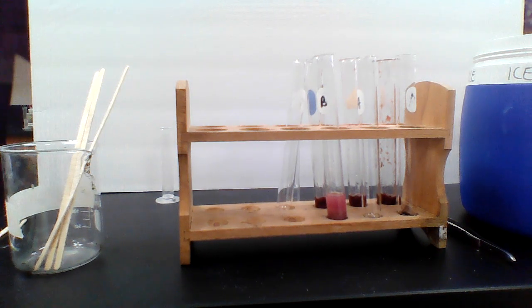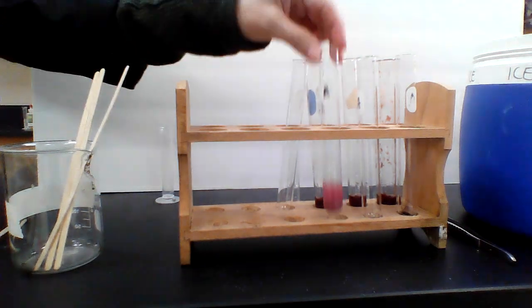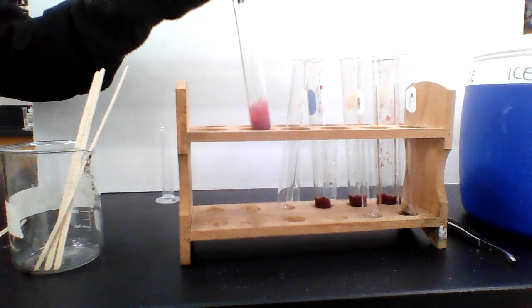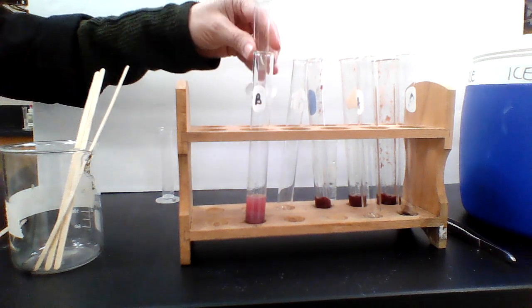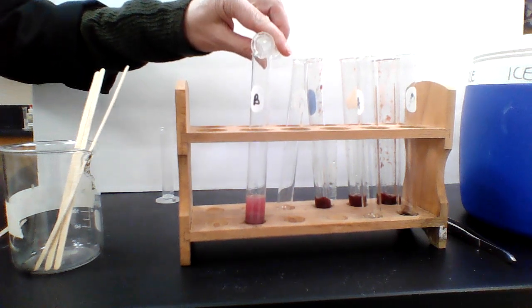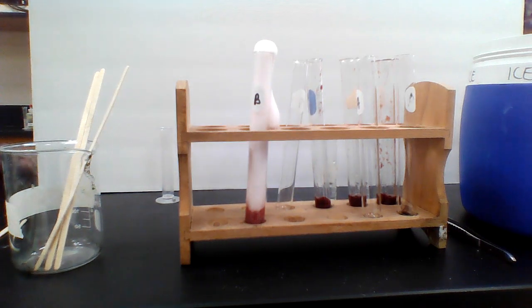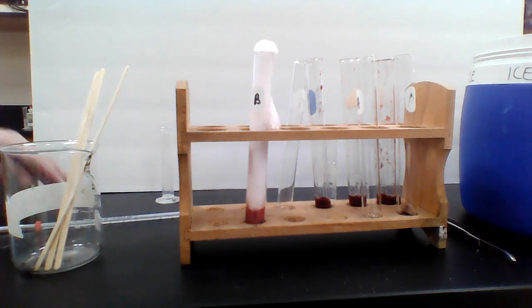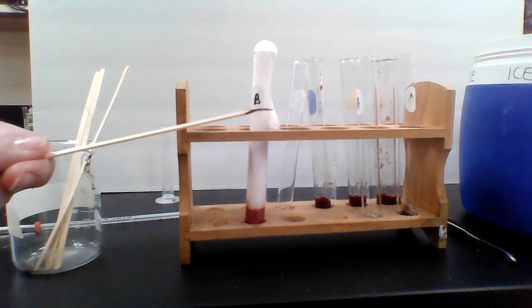Next, we're going to take a look at the crushed liver. I'm going to clean off my messy thermometer, like I should have done the first time. All right, and now I crushed this liver in a mortar and pestle. I did add a little bit of water to help it crush a little bit better. And now I'm going to add the hydrogen peroxide to it. Oh, Nelly. That would be another 10, it looks like, right over the top of it. So we'll go ahead and try another splint test. It's hard to do the splint test when they bubble all the way up to the top that way.